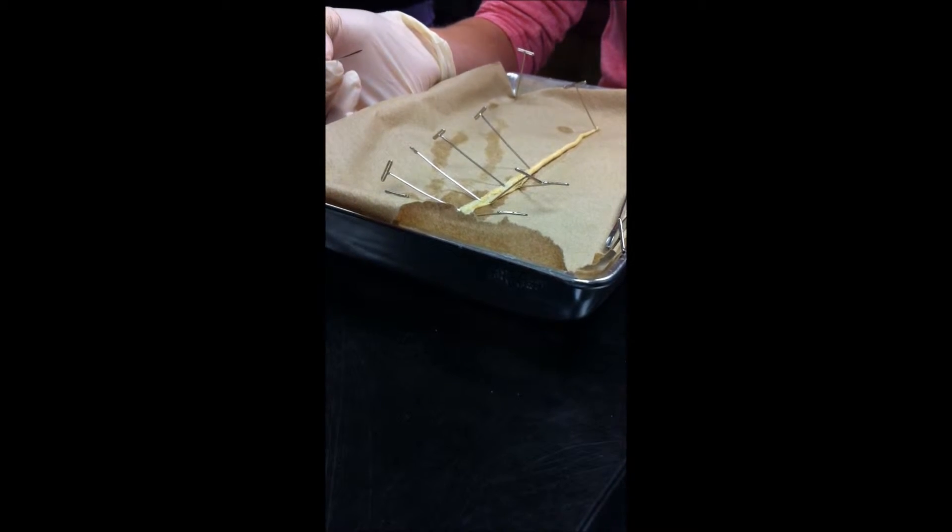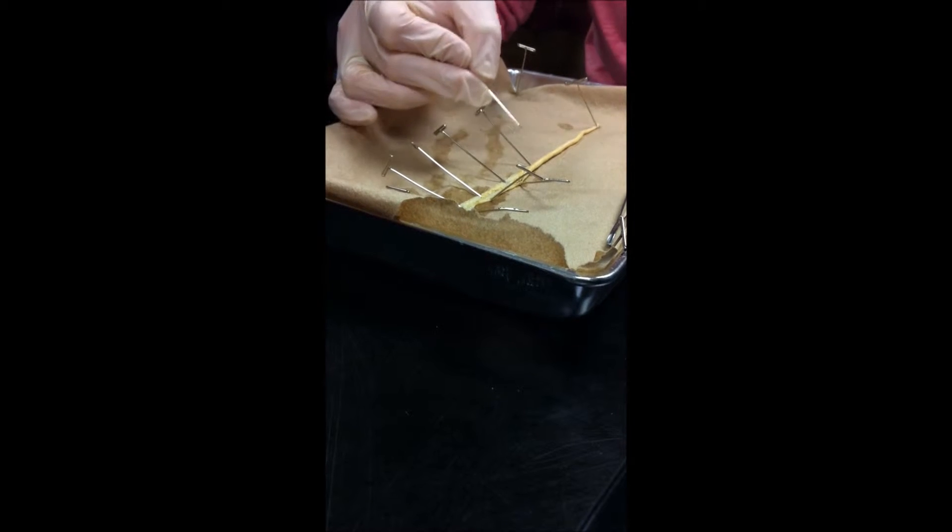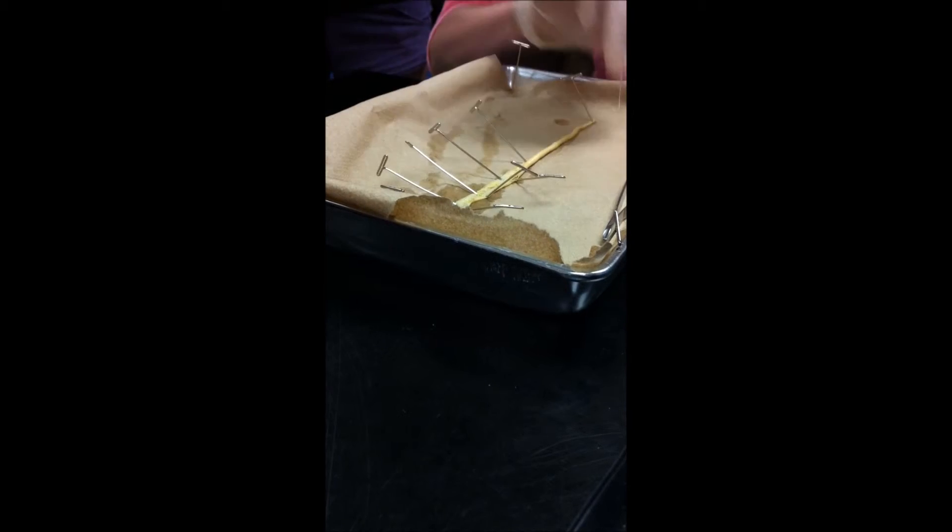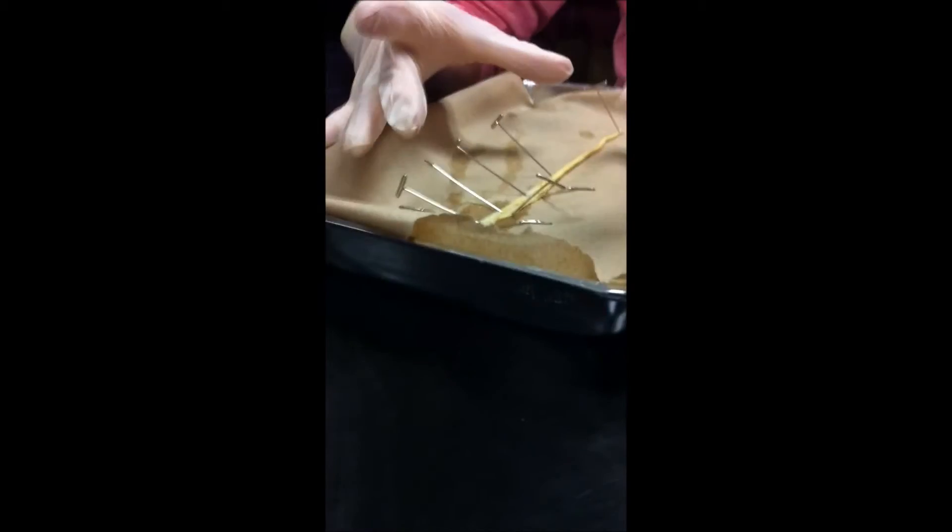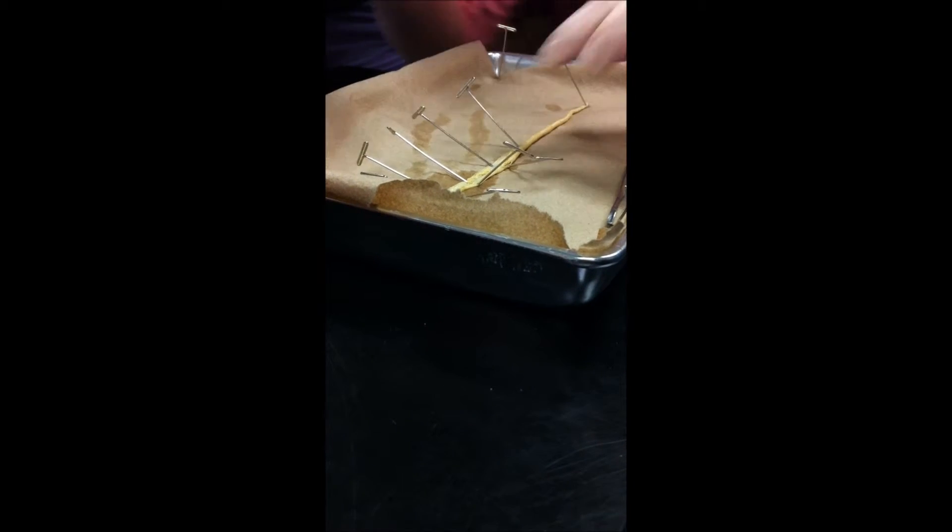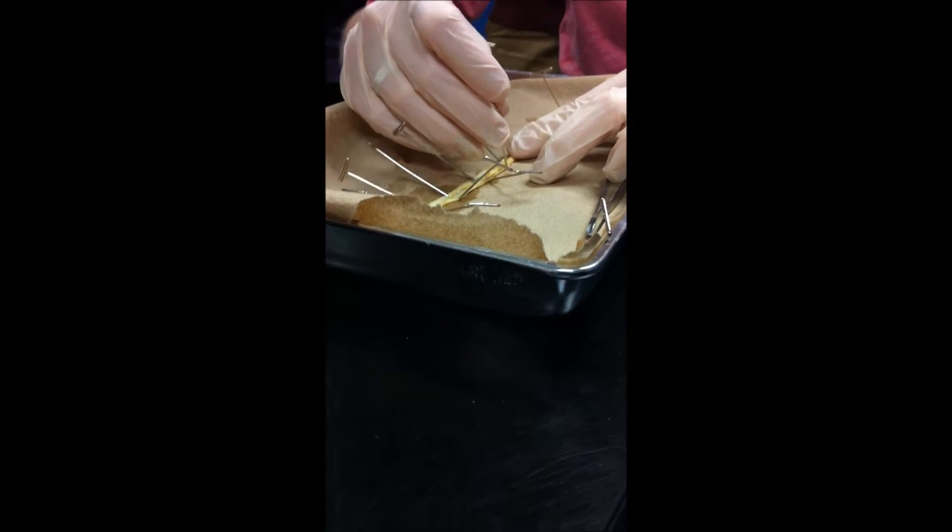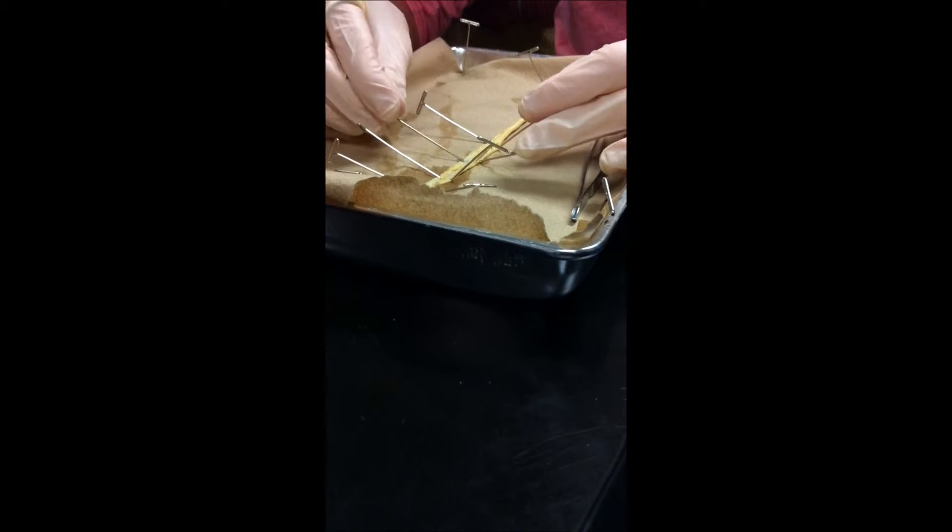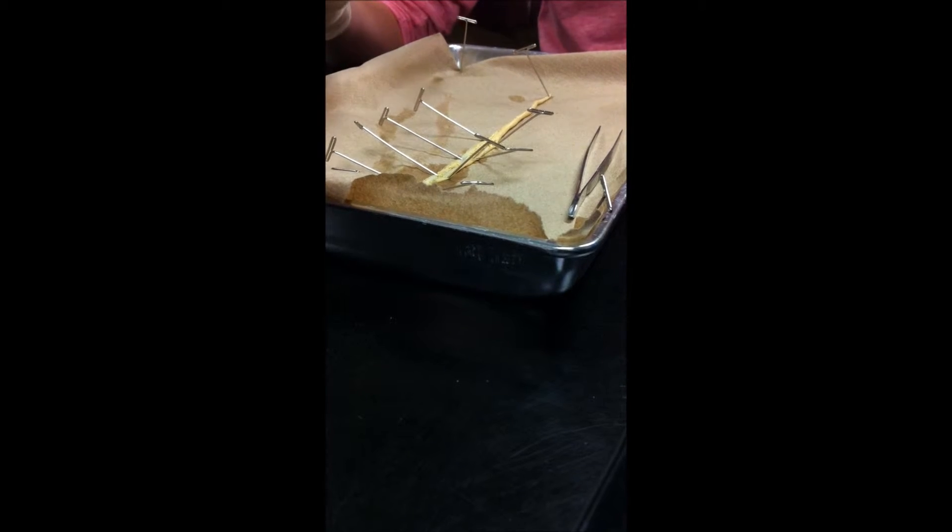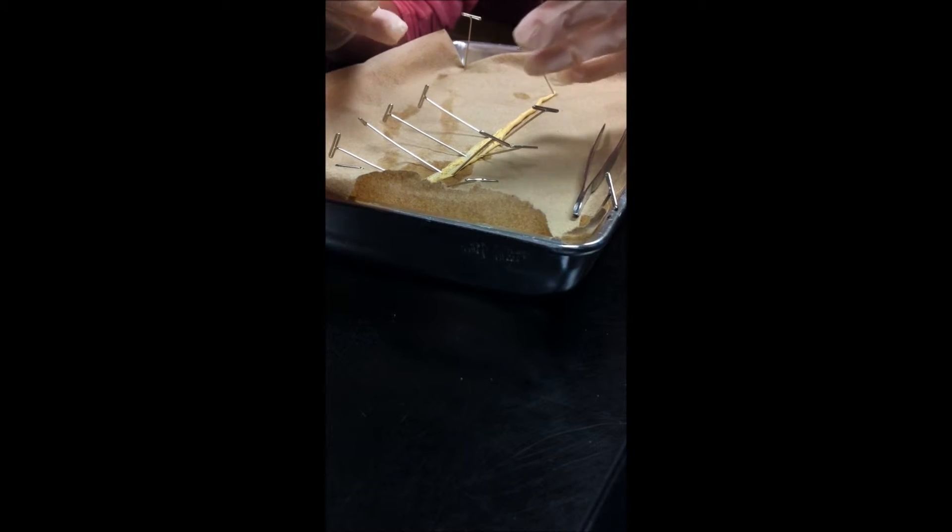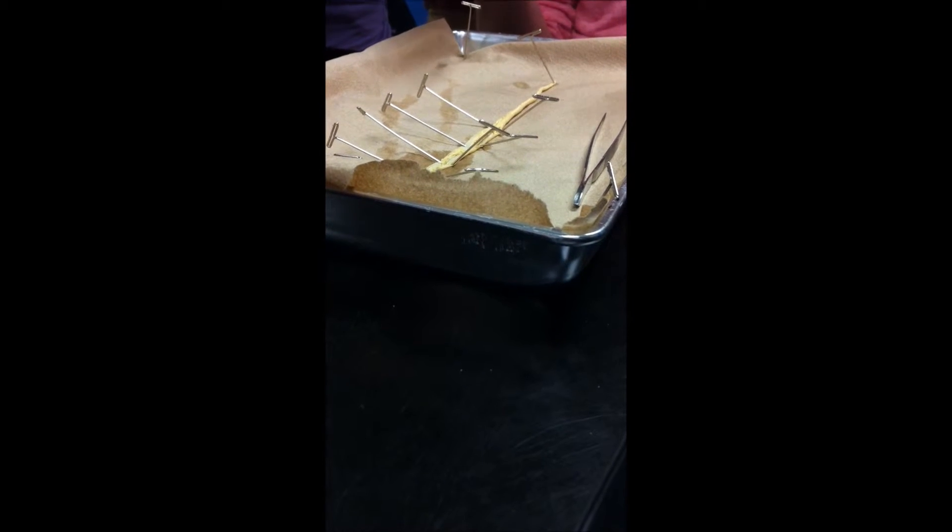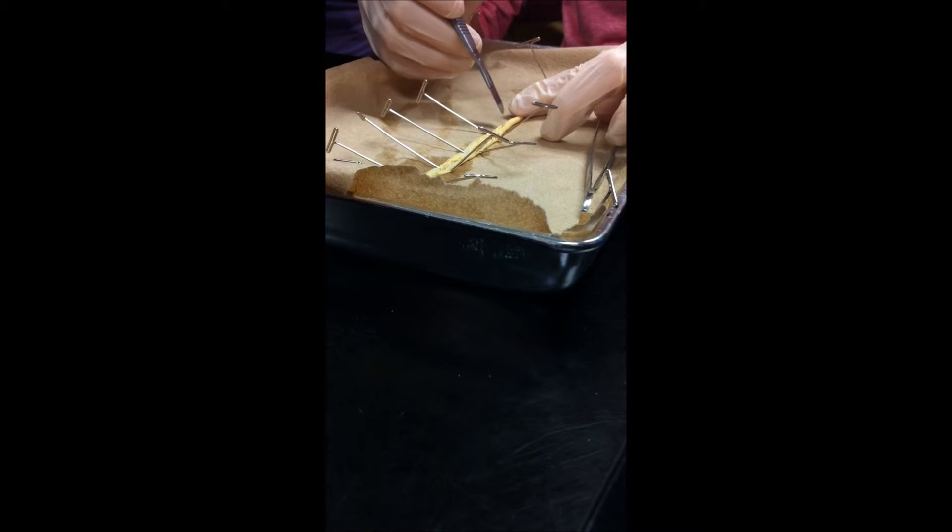How does it move? There's muscles. And if you look really closely, there's muscles, these muscles here, they run vertically up and down, so the worm can squish kind of side to side, and that's what allows it to wiggle and squiggle. And it has nerves in there? Not a ton of nerves. This is a parasitic worm, so just like all our other parasites, it doesn't need to be able to detect its environment because it's living internally. If it was an external or a free living one, then it would have to detect its environment, find food, watch for predators, that kind of thing. But when it's living internally, it doesn't need that. So it appears degenerative, but it's not actually degenerative.